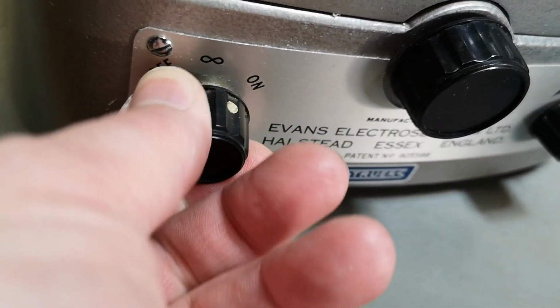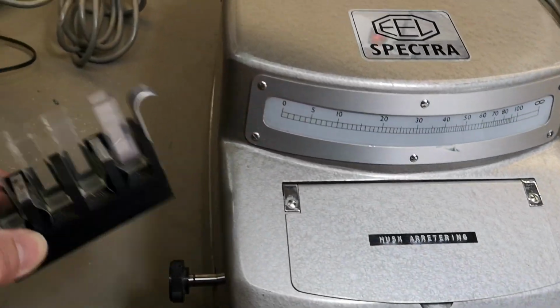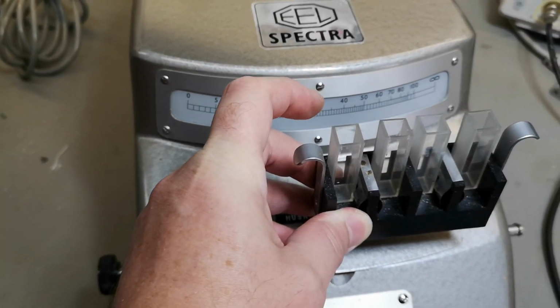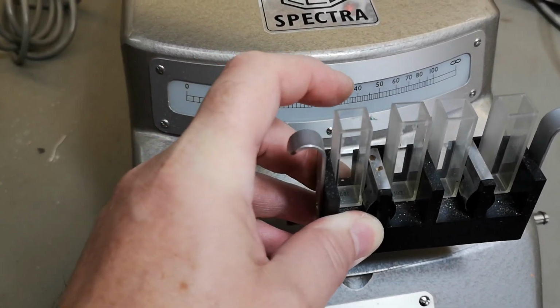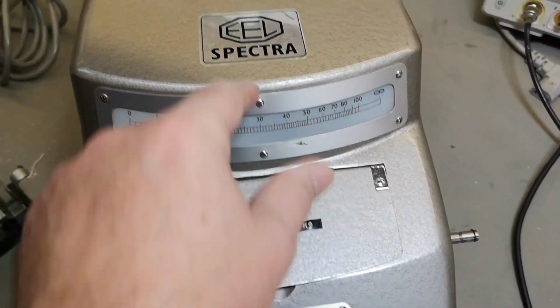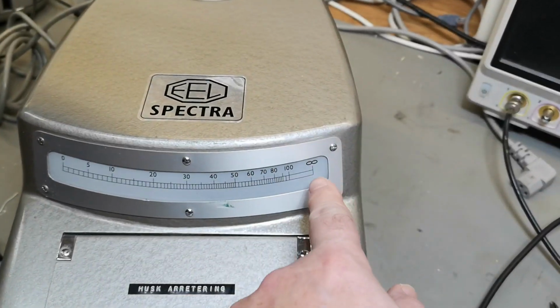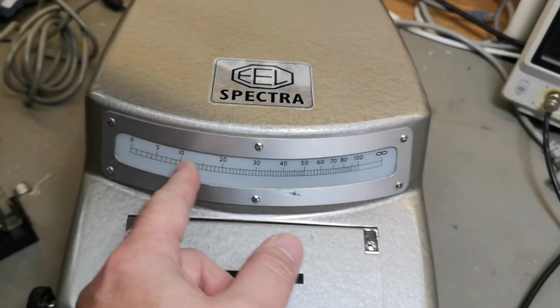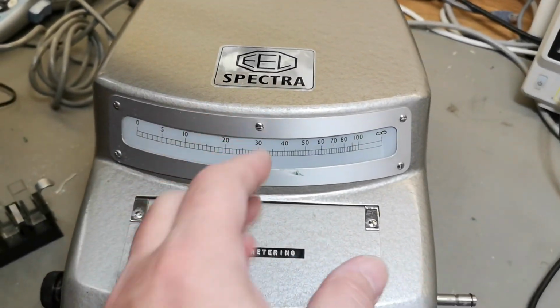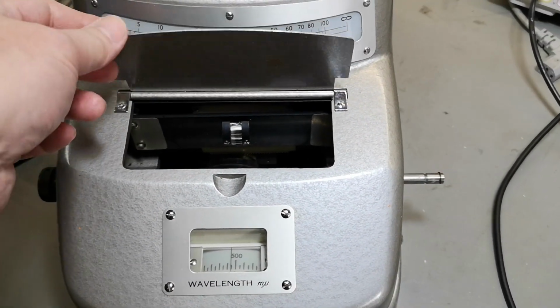And I think that maybe this is what you do. You crank this up in the infinity, so that means the calibration. You have your probably an open sample, and this is of course your calibration, and then you have whatever you want to sample, right? So in the first one, then you adjust here until your readout is on the infinity sample, and then you will see different levels at the different wavelengths probably. So that's most likely how it works.